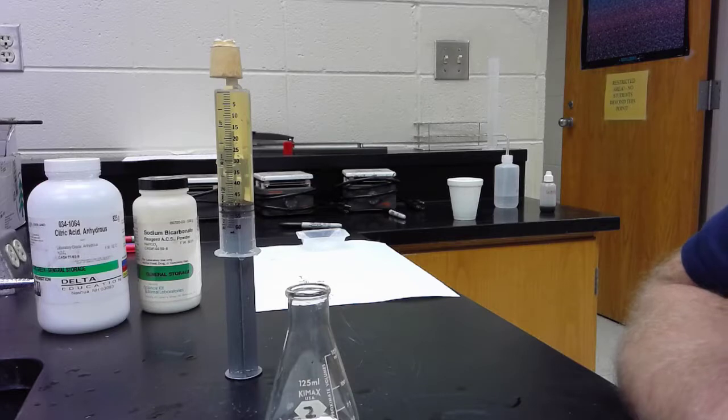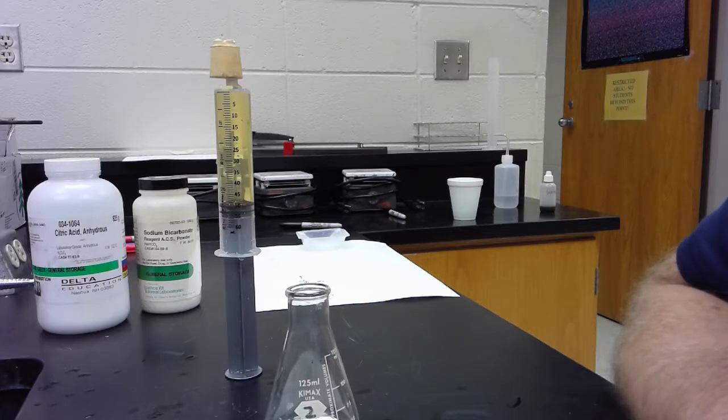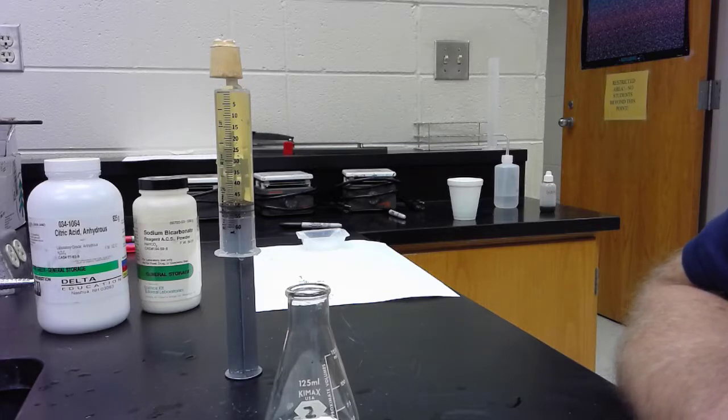Now in case you think my water is bad, if you think it looks a little yellow, it does. I've added a little bit of universal indicator to the water and we'll just see what happens when that's added.